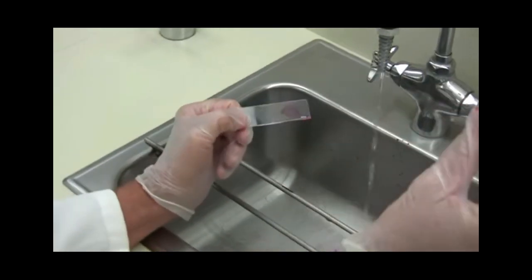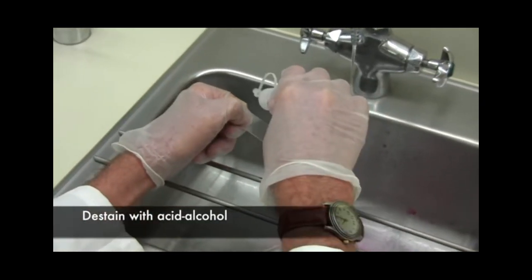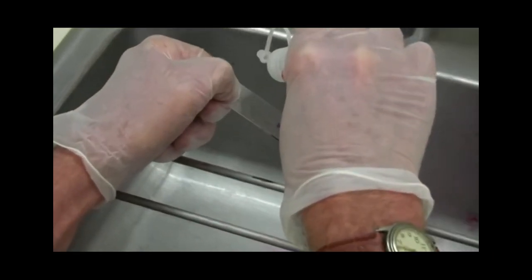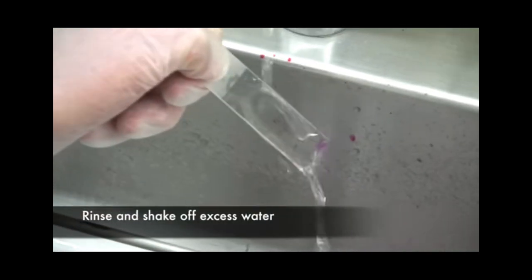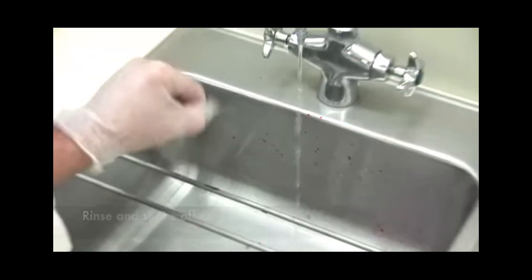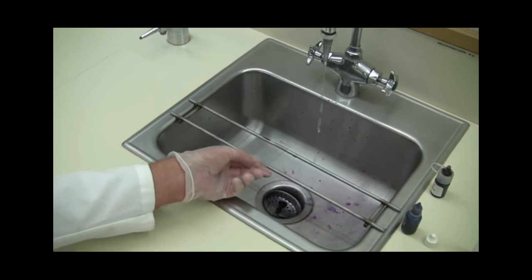Decolorization will be using 5 to 10% sulfuric acid or acid alcohol. Wait for the sections until they are faint pink to know that you are already done — that is around 1 minute or until the sections are already faint pink.